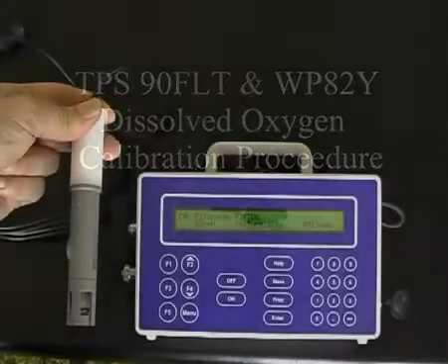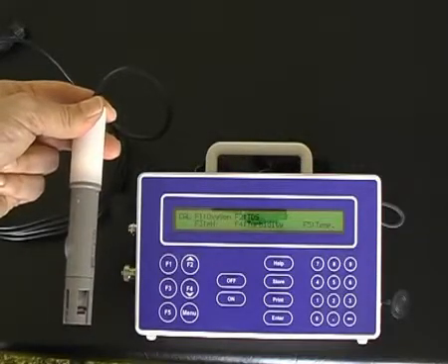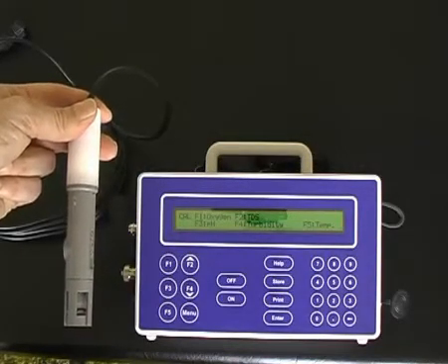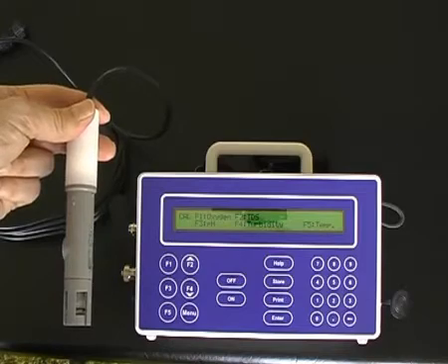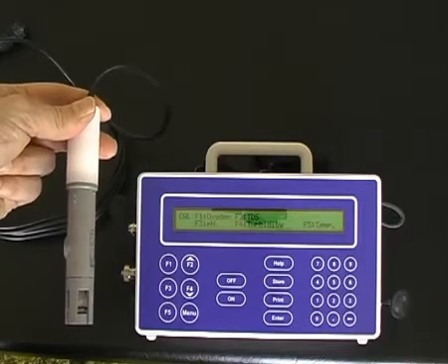Dissolved oxygen sensor calibration. It requires a two-point calibration, the first point in a sodium sulfite zero solution, and the second point, the dry sensor in air.